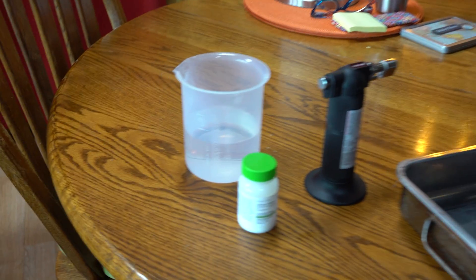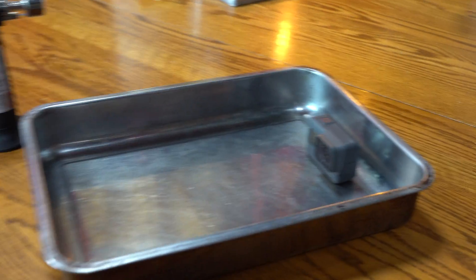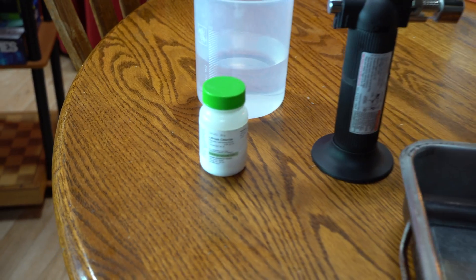So yeah, let's just set it up and see what happens. This is the setup — I have a tray here with a GoPro to get a close-up look, and I have the lithium chloride and water nearby just in case things go sour.